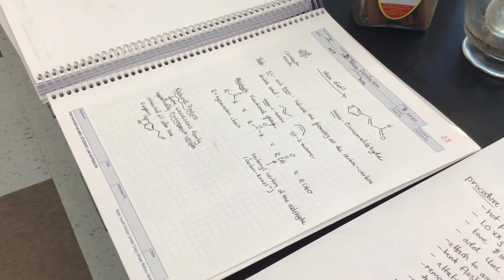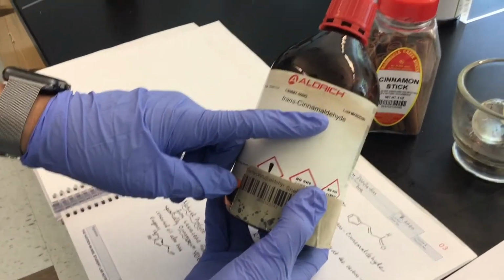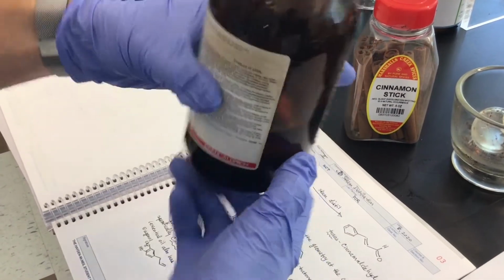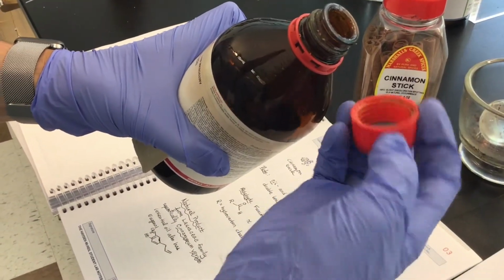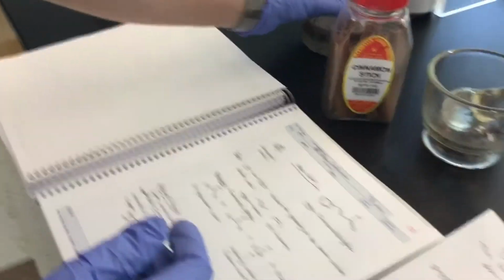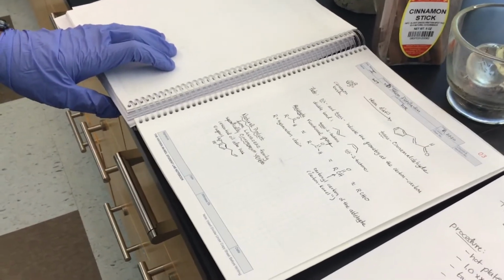So, in fact, we've got a bottle of trans-Cinnamaldehyde sold from Aldrich, a very famous chemical company, which is pure trans-Cinnamaldehyde. You see that it's a free-flowing liquid, and the minute that you open the cap of the bottle, it smells just like cinnamon. So trans-Cinnamaldehyde has been identified as the smell of cinnamon, but since we're dealing with the natural product itself, what will steam distill over as the essential oil are also other components.